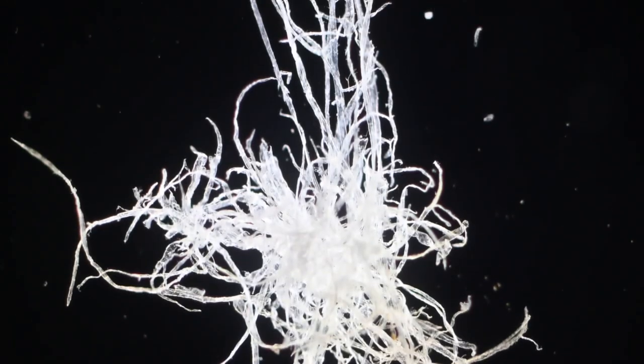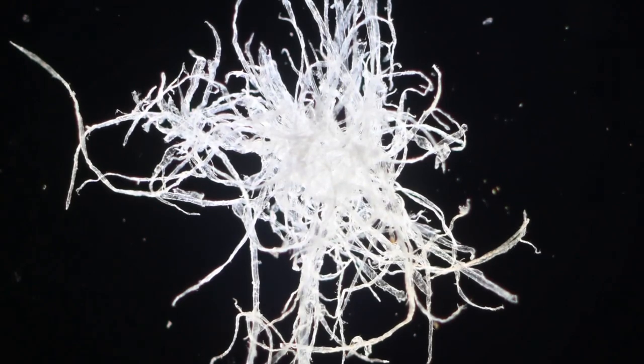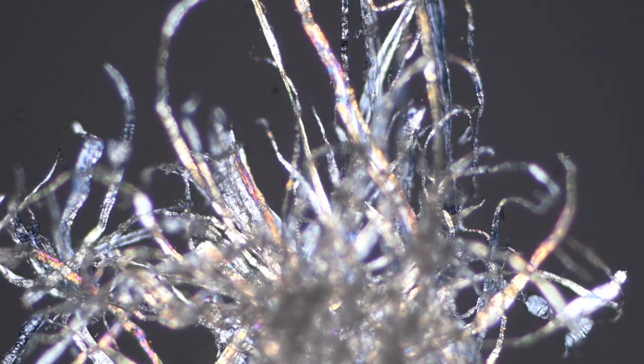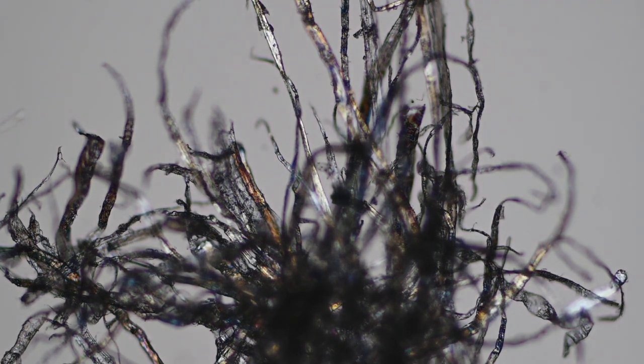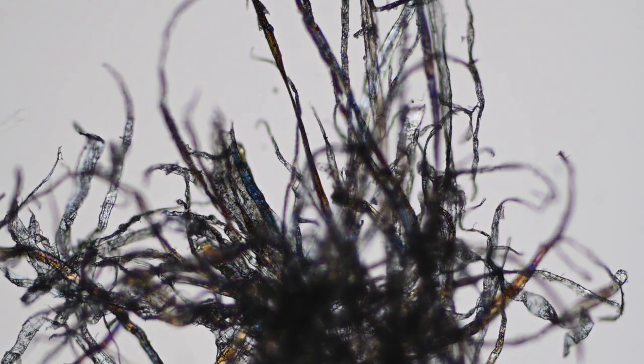But I think maybe my favorite is using polarization because of the way these particular fibers move and shift the polarization planes. And you can see some very cool effects. So you have the same fibers looking at it a little bit closer. I'm going to bring in a polarization plate into the picture here and take a look. And I can shift the polarization, and some of the details of the fiber come out so much more because they move the polarization angle and rotate the polarization in different ways or filter different polarization planes. The effect can be really mesmerizing, especially if you weren't expecting it.